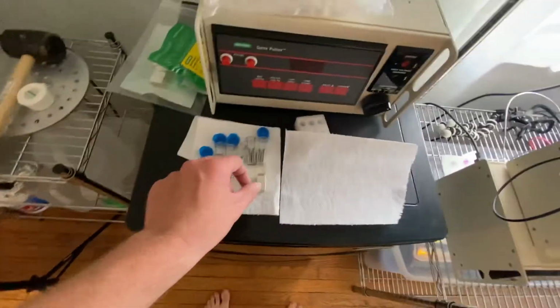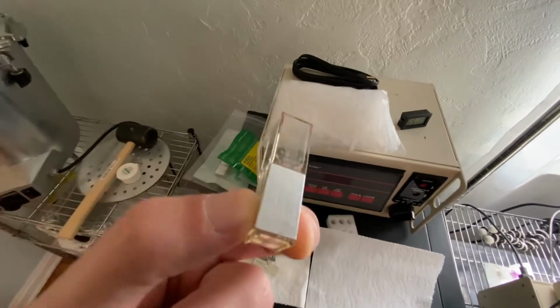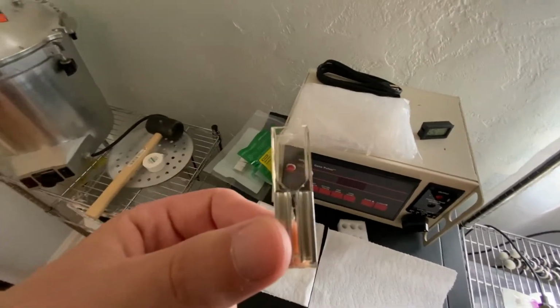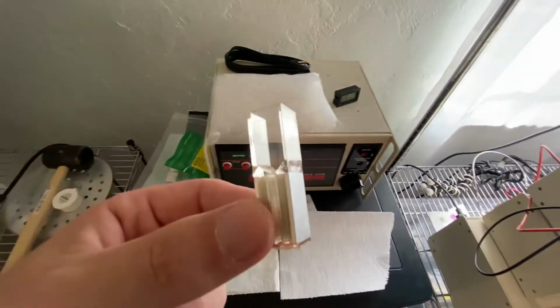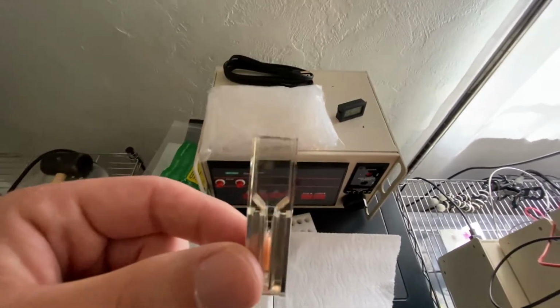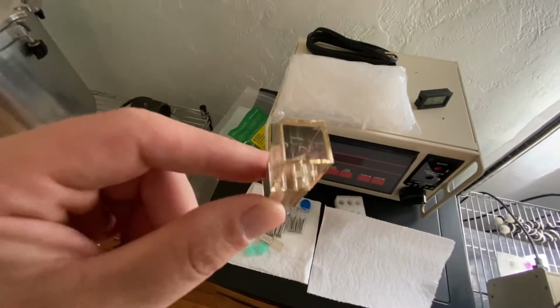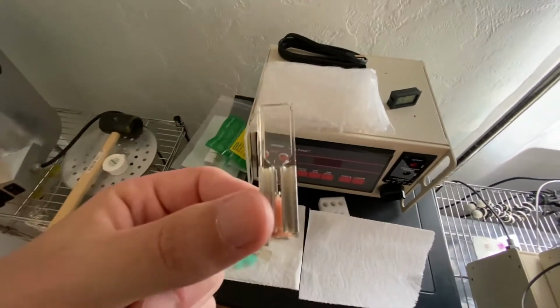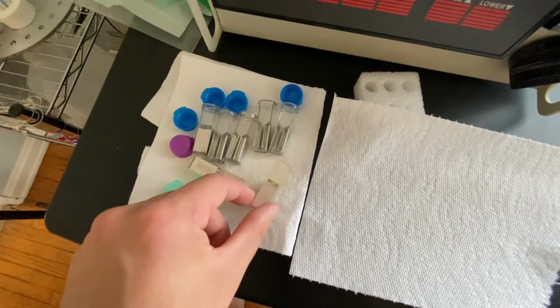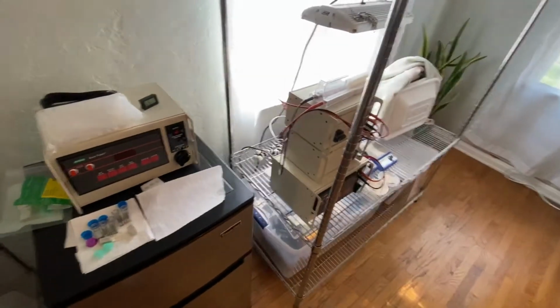One is I'm going to take one of these cuvettes, and I'm going to once and for all sit down with one of these and just practice pipetting some LB broth in here, using different kinds of pipette tips and pipetters, and see if I can't figure out how to maximize my efficiency for recovery, and see if I can't find a technique that works reliably. Because if we don't fill that with fresh LB and then suck up any of the transformed cells, well, everything down the line is just not going to work.